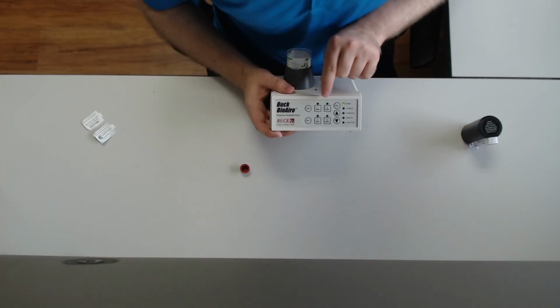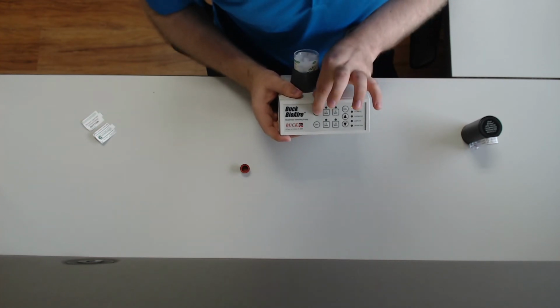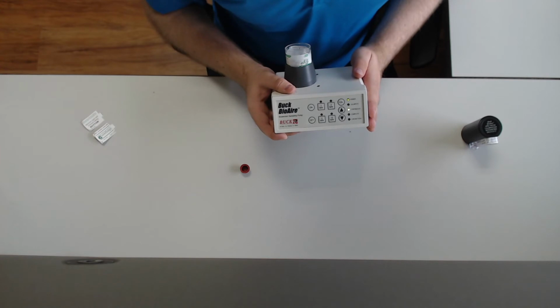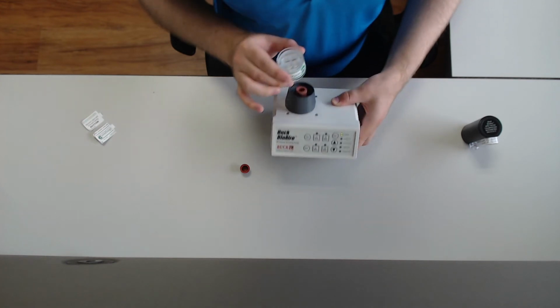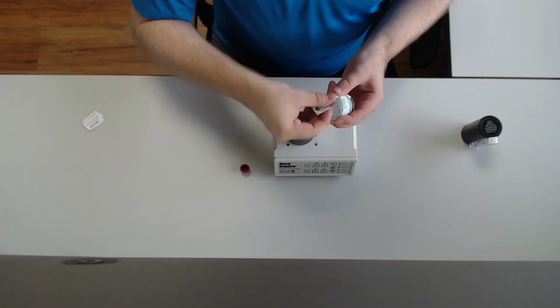Step 7. Press one of the time keys to take an automatically timed sample, or press the on button for 4 seconds to manually time the sample. Your sample time should include the time that passed while calibrating the pump with the cassette attached. Step 8. Remove the cassette from the pump and replace the quality seals on the top and bottom of the cassette.